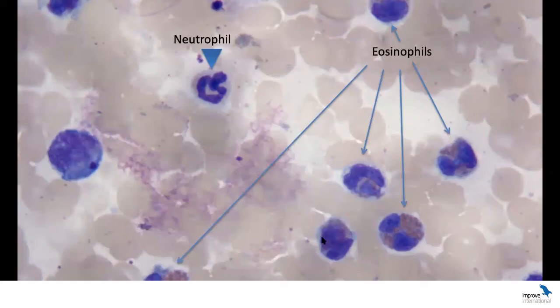And I'd like to point out that when we have eosinophils in tissues, when they move out from the blood into the tissue, they often lose that ribbon-shaped nucleus that we have, very similar to the neutrophil in the peripheral blood. And in the tissues, they assume this more bilobed or sometimes even a single, rounded nucleus. But they're still easily identified by their granules.